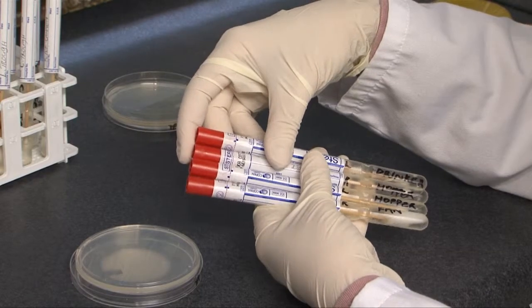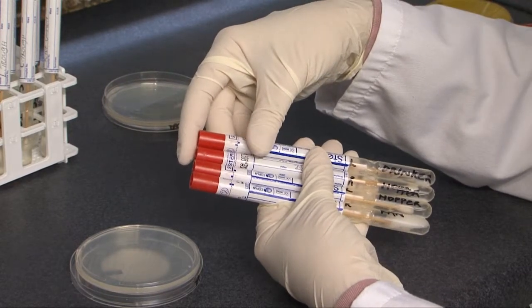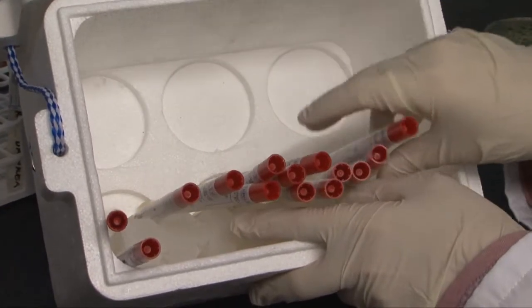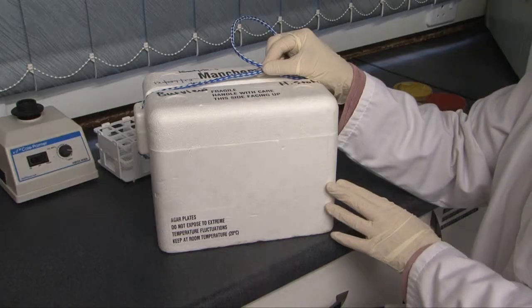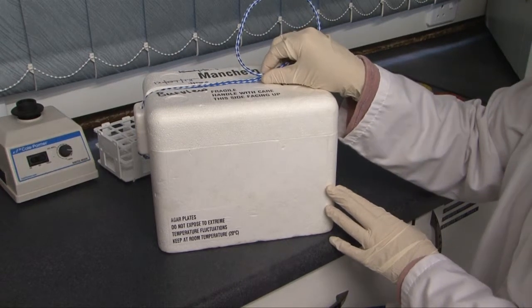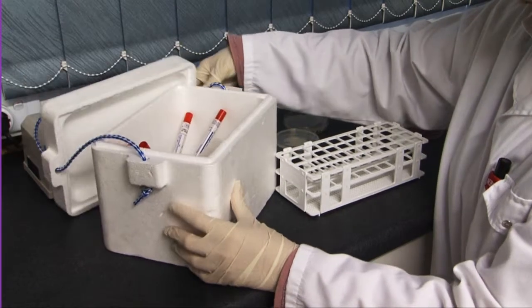Make sure the plastic base fits snugly into the tube to ensure the swab does not fall out during transportation. Clearly label each swab sampled with a number that corresponds to the surface description on the information sheet. Place the swabs into an insulated sealed container — in this case a polystyrene cooler — together with an ice brick which will maintain the temperature at about 4 degrees Celsius. Transport all swabs post-haste to the laboratory.